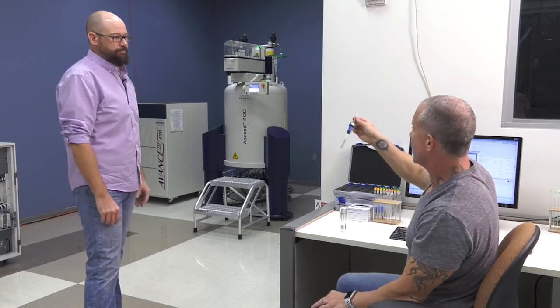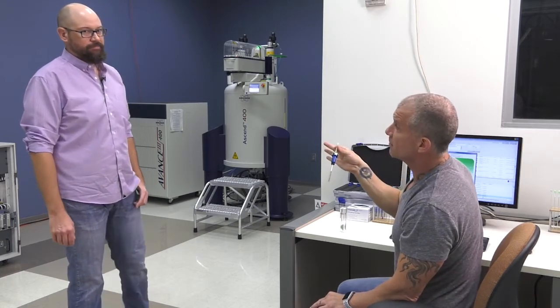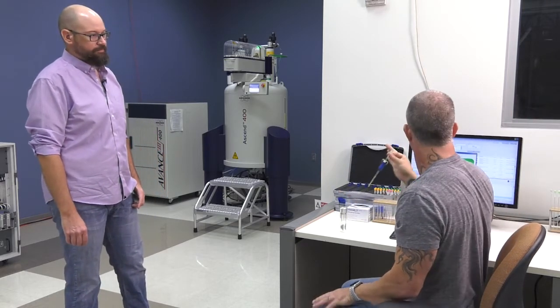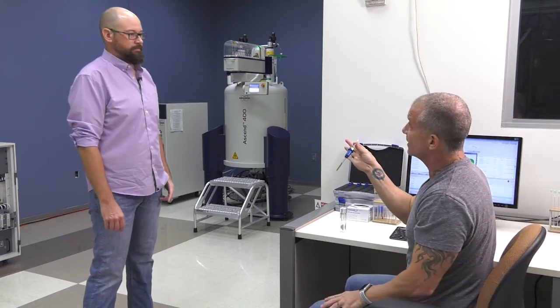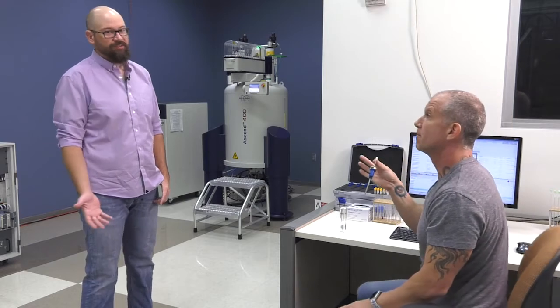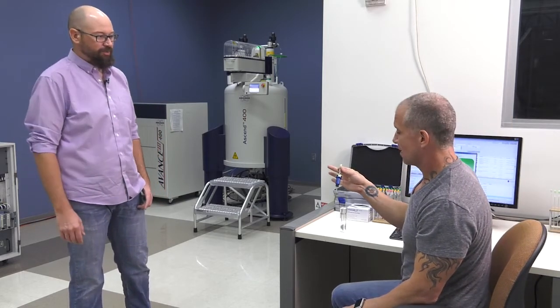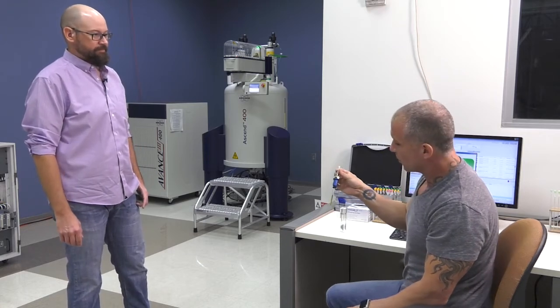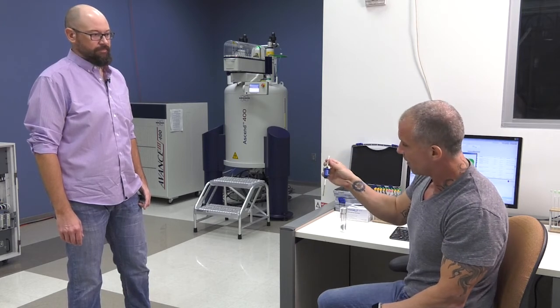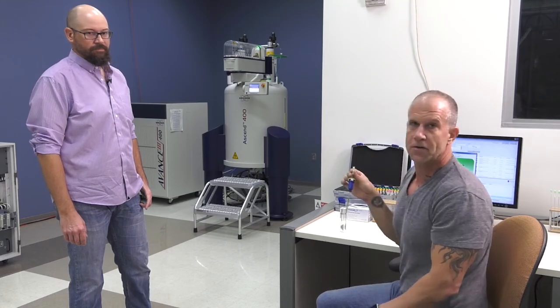So now we're ready to take this sample and put it into the automated system. Correct. And we do this before we do anything else on the console. Right? So it's only after we've added this sample that we would click on the start button here. Otherwise, if there was nothing pending in the queue, it would automatically start running that experiment looking for it, but there's no sample in the spot. So you do that first. Okay, perfect. So I think we're ready now to put this onto the automated system. Thanks, Brian, for helping us get this sample going, and I'm looking forward to figuring out how to get this onto the automatic system.